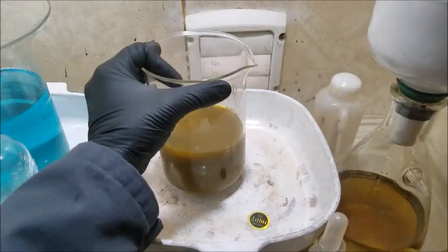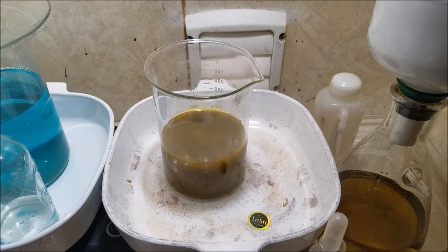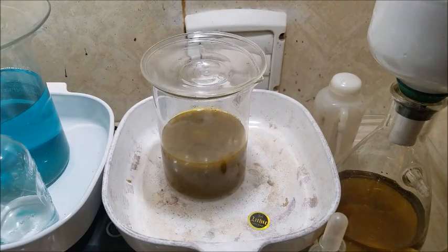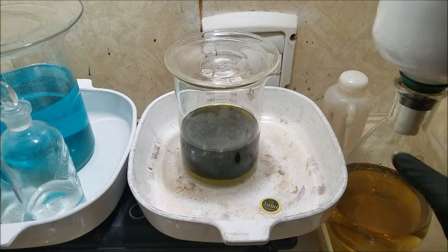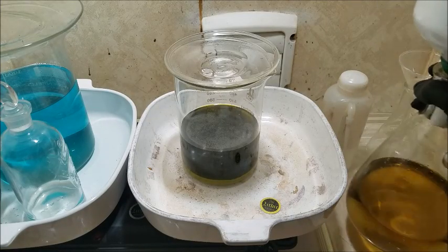I will be happy to pour this off. Alright, I'll let that cool for an hour or two and we'll come back and pour it off. Our solution is cooled down. We're ready to filter it here. Just gonna maneuver a few things.